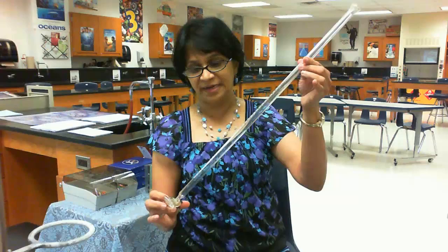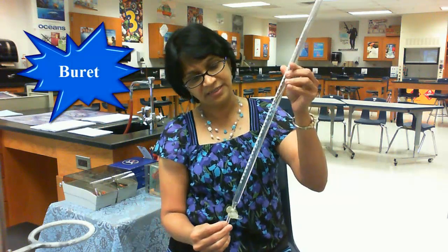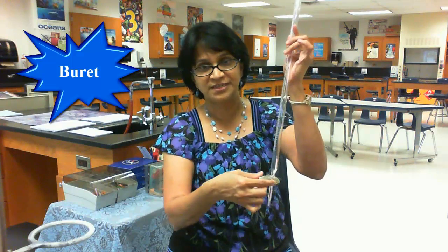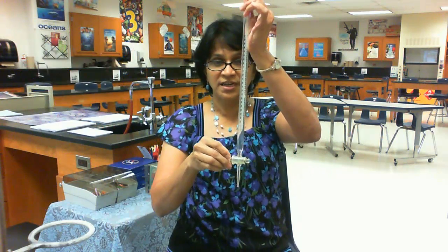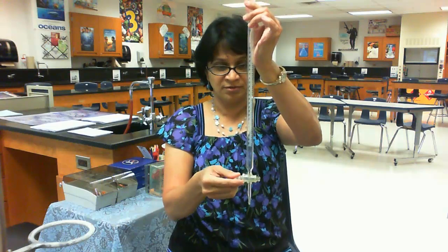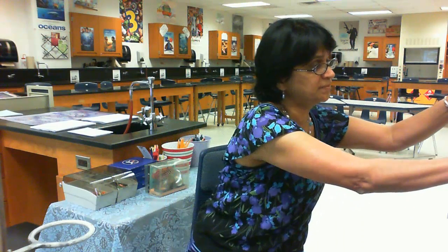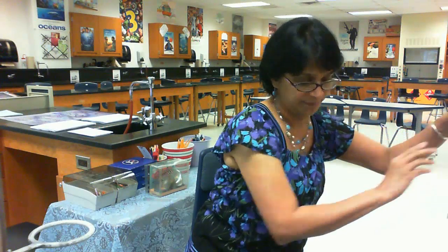Here is one more equipment called a burette. There are markings on the burette and it is used for delivering liquid into a chemical reaction. These markings are fairly accurate and we get precise measurements using a burette.